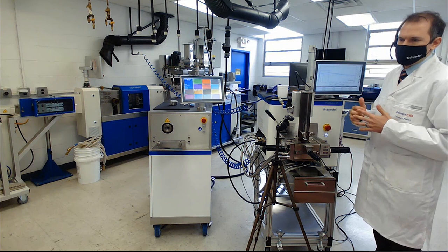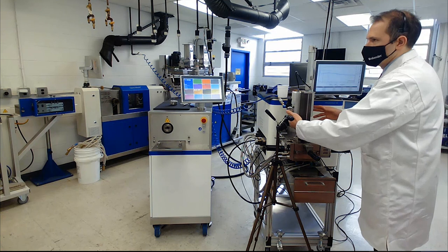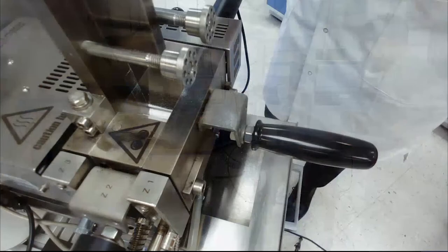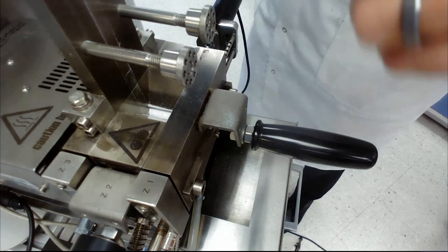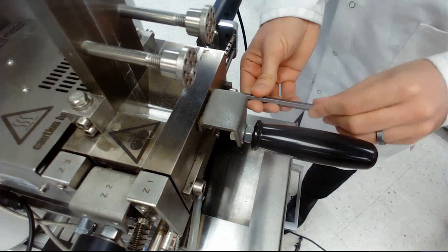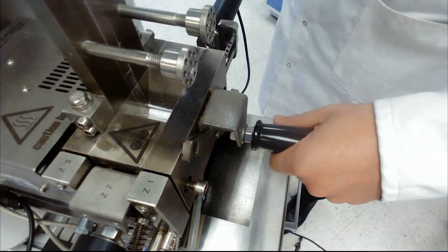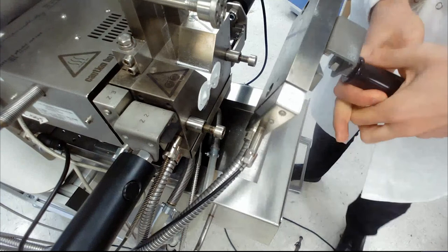This is now our cleaning steps. You see I lifted our column. I have an Allen key in this edition of the mixer, and I will just remove the front plate carefully. I have to move the camera a little bit because I don't want to ruin that, so we just go quickly over it, brush the material.